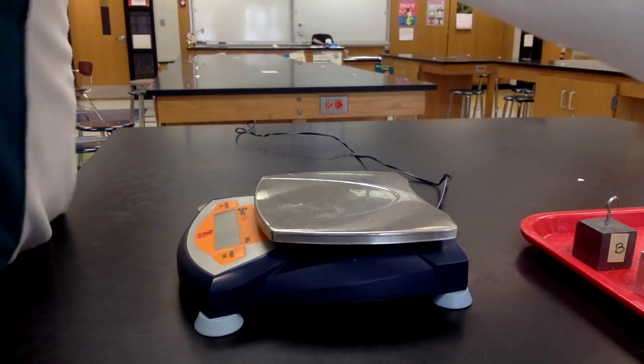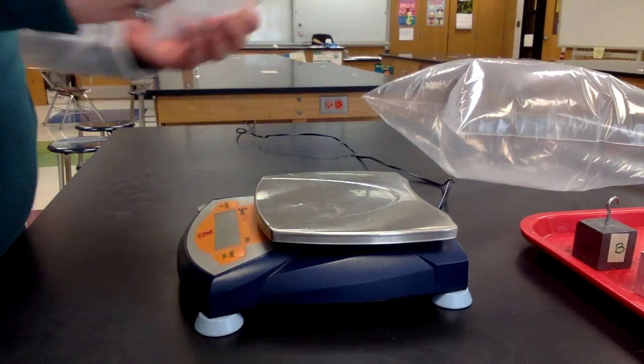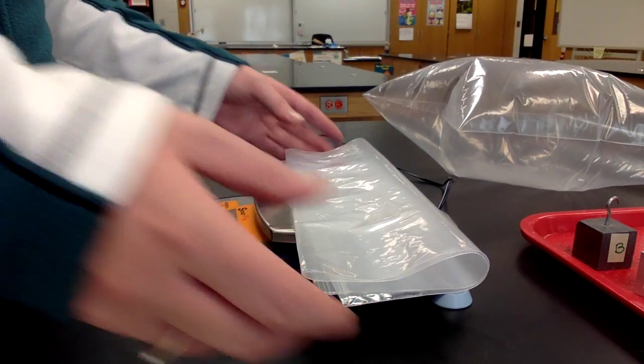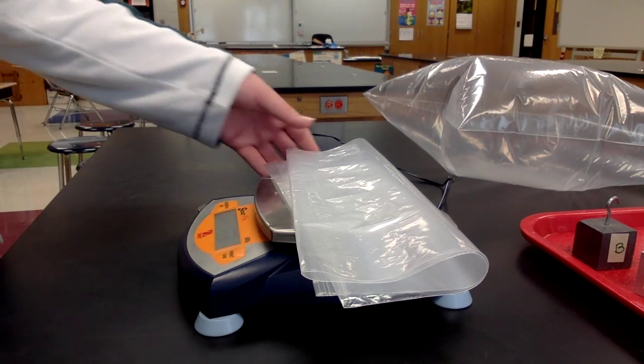I have the gas in a container. I must first measure the mass of the container itself. Record that information on your paper.